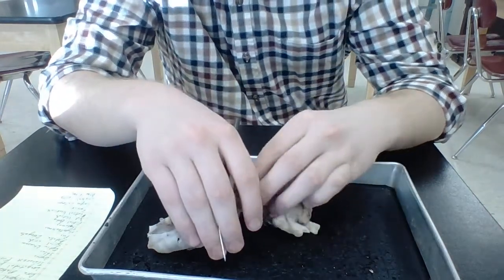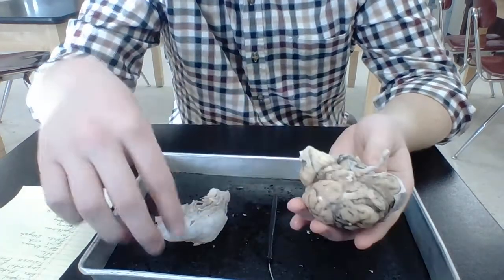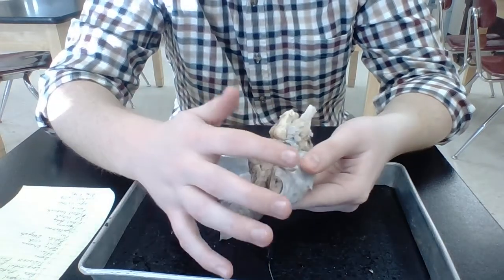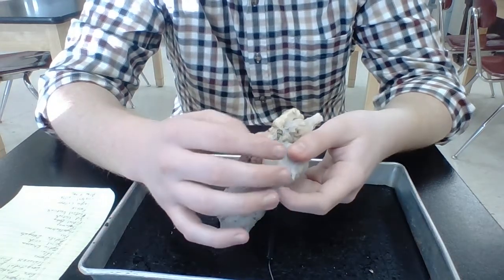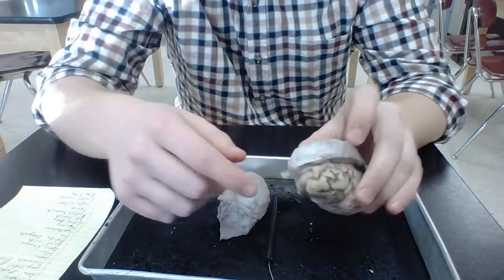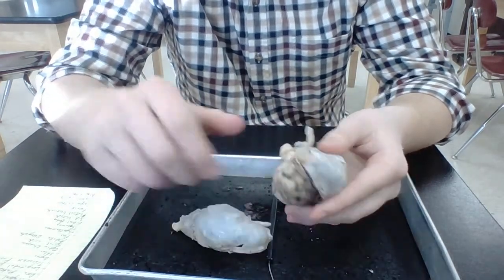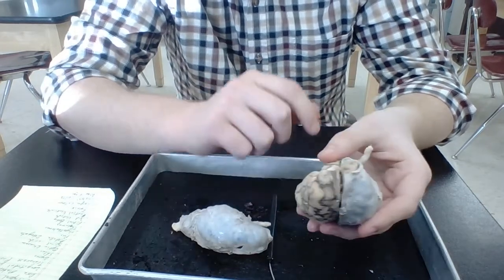All right. So we're going to flip it upside down. So we took off our optic chiasma, but these things right here are things that eventually attach to your eyes. So optics, that's where you get that name from. And this is your optic chiasma, right here. All right, so that's this little dangly structure, and there would be two of them, but I ripped off the dura mater there. So that's what that came off of. So that'll also attach here as well.